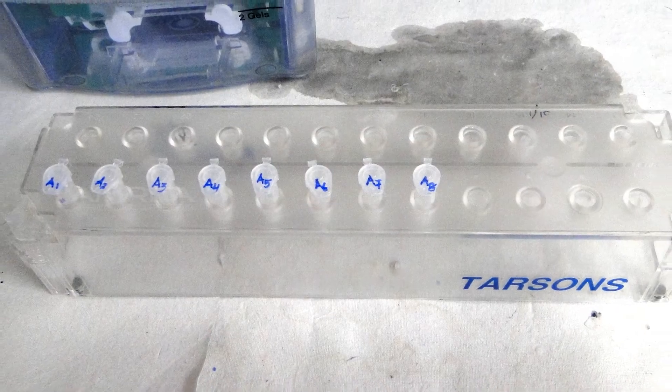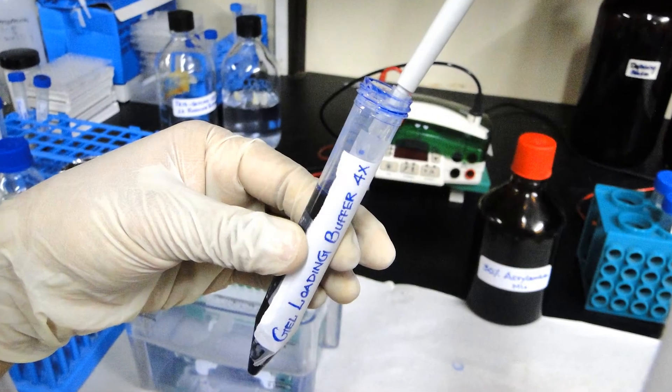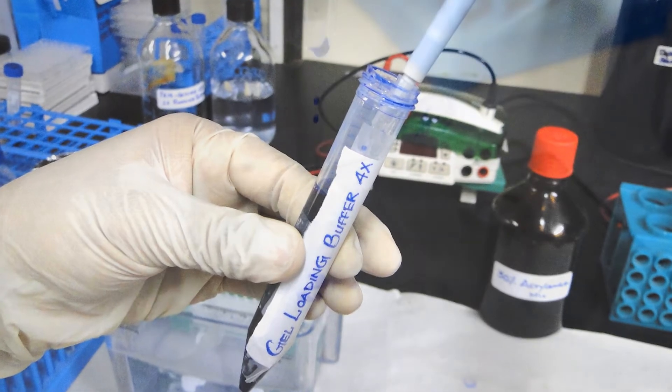Meanwhile, prepare the samples for loading into the wells of the gel. Mix the protein samples with 4x gel loading dye in the ratio of 4 to 1.